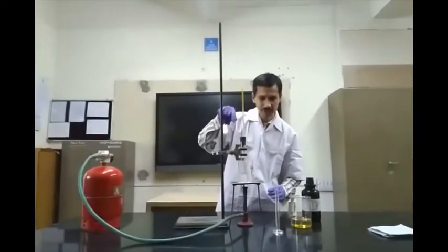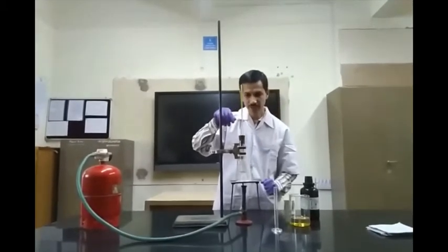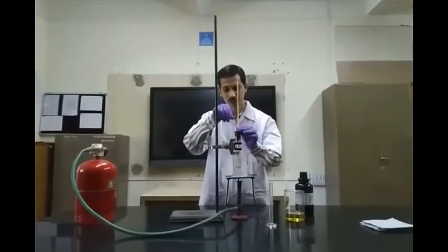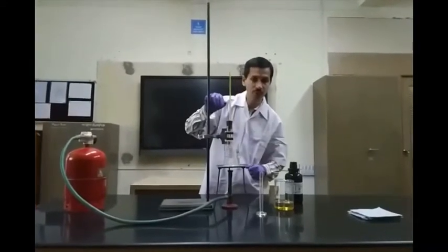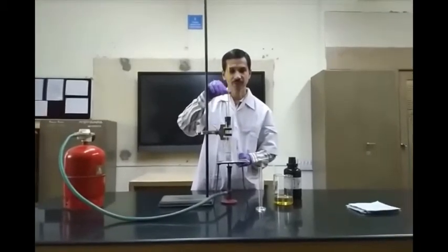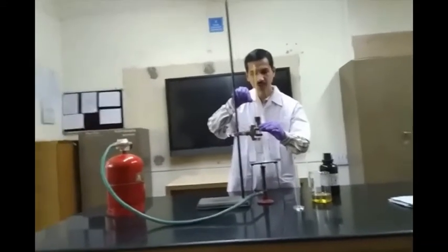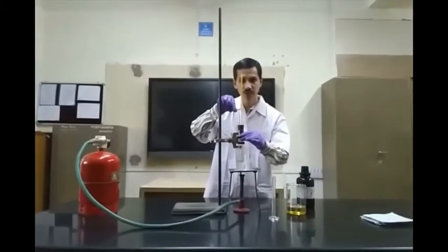We put the test tube in a water bath and start heating with the Bunsen burner. We will periodically mix the diesel and aniline and try to find out whether they are miscible or not. The temperature will be recorded constantly, and the temperature at which both layers become homogeneous is called the aniline point. Our lab assistant Mr. SM Morae will be helping us perform this practical.